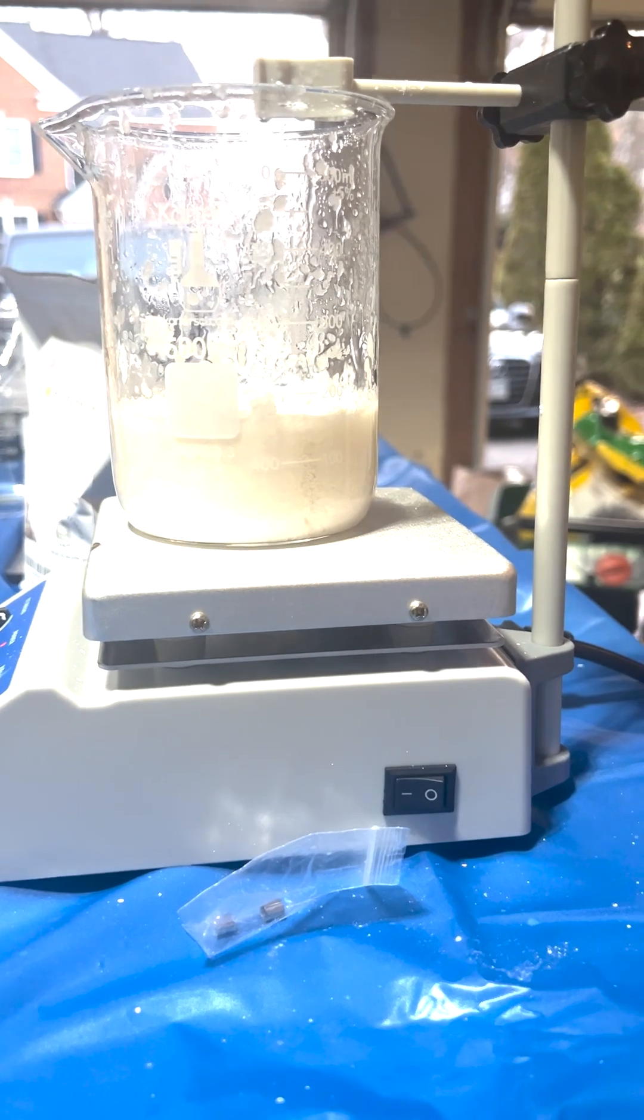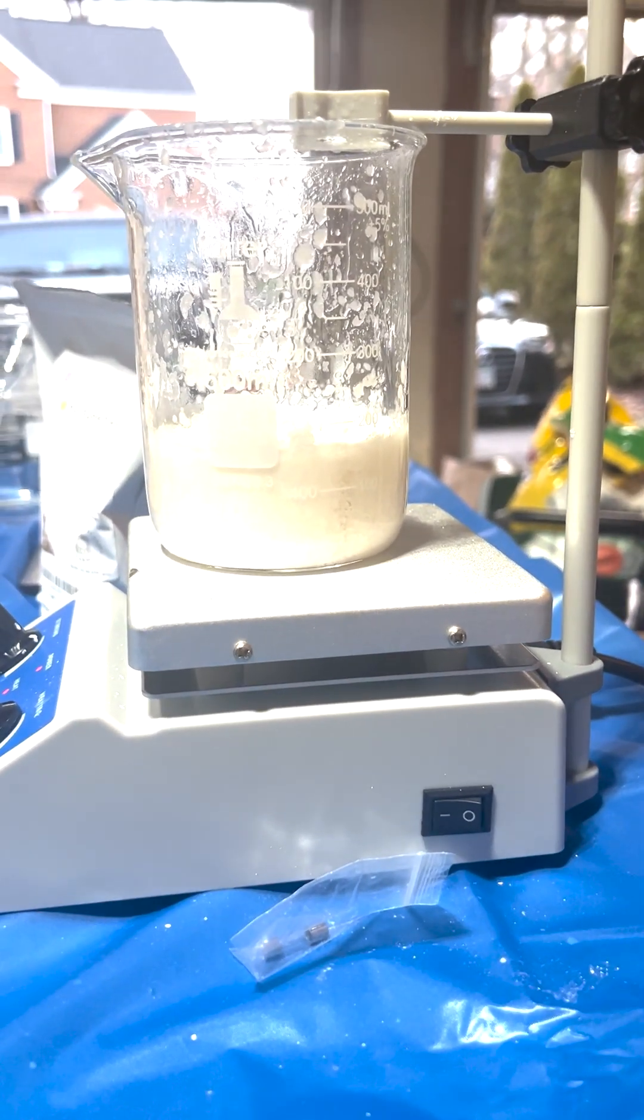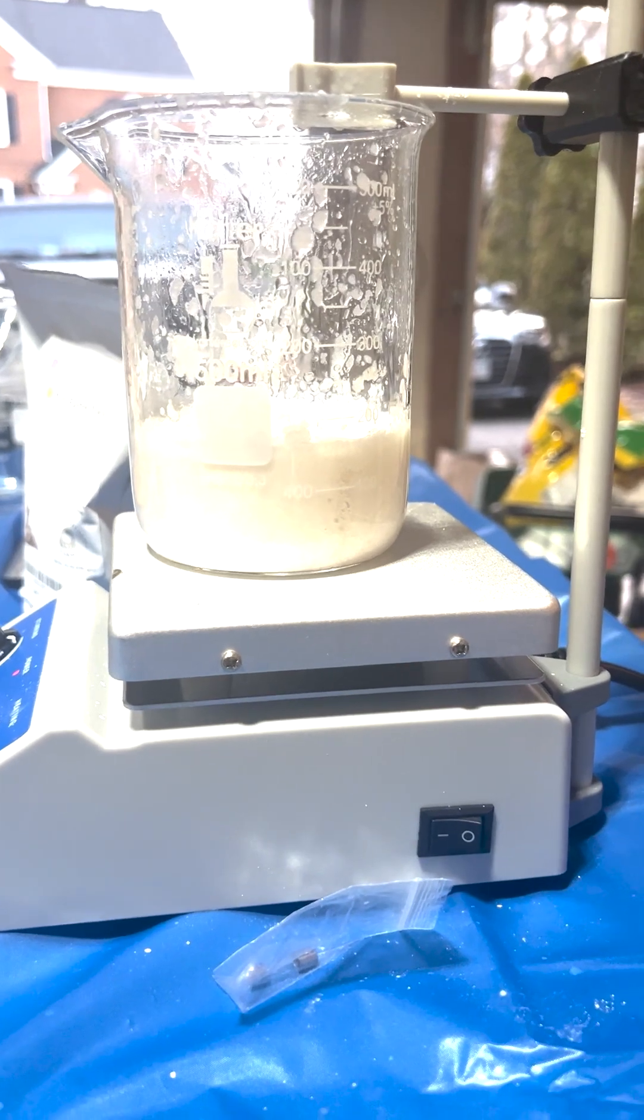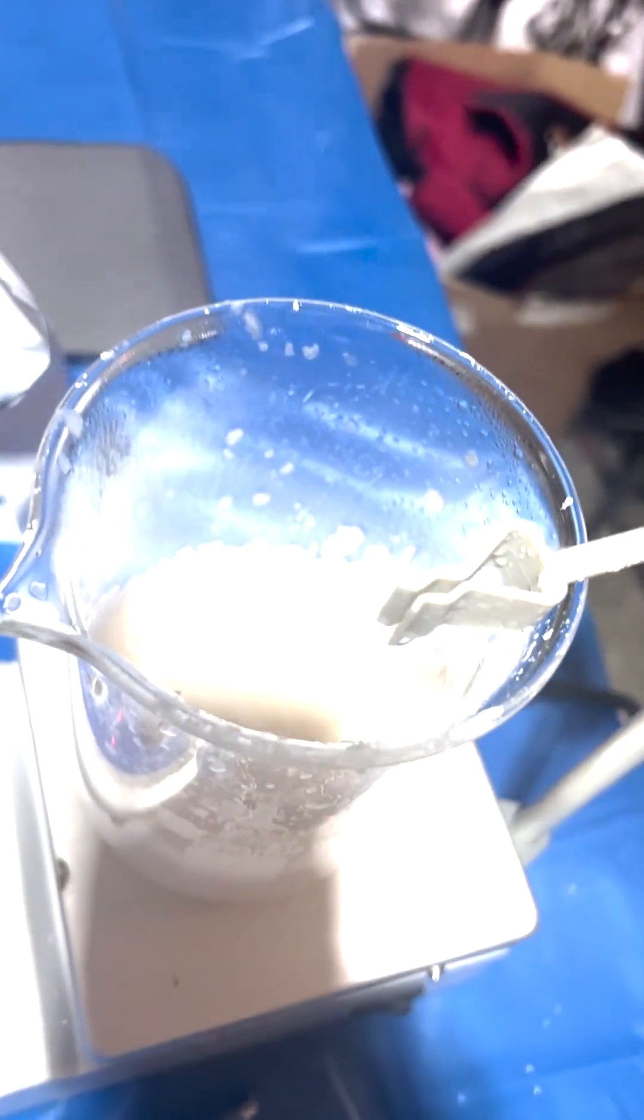Now we're getting to that point where all the impurities are starting to burn a little bit, so as soon as we see this solidify a little bit more, it's gonna crash out, and we have to immediately take it out, so we don't really want our acetate burning.